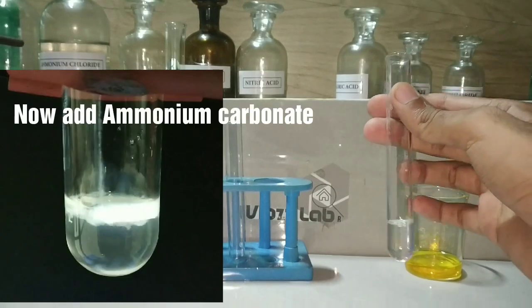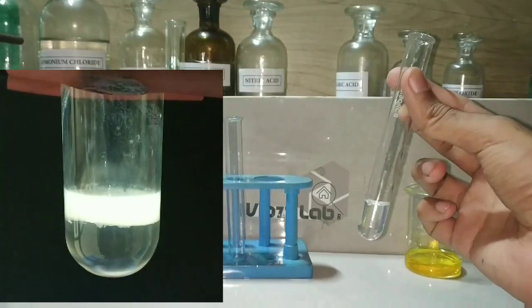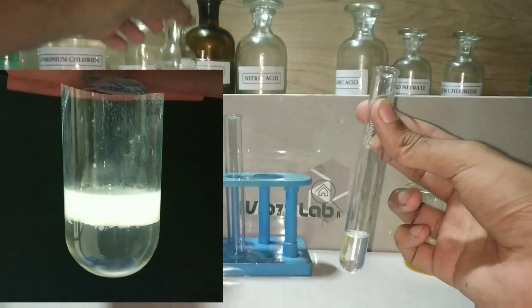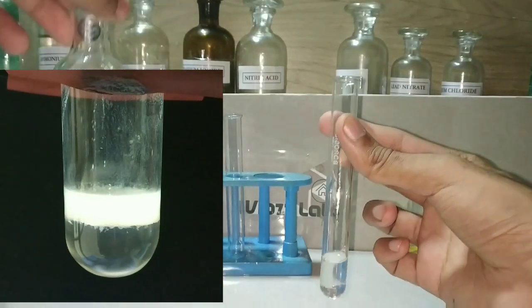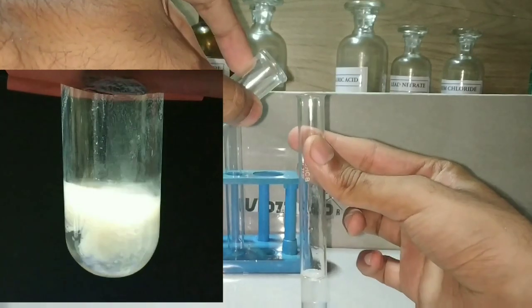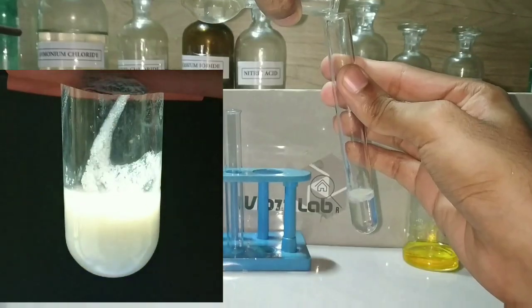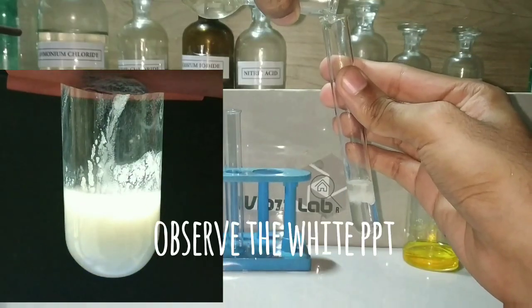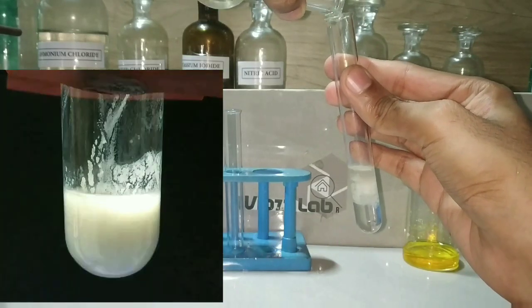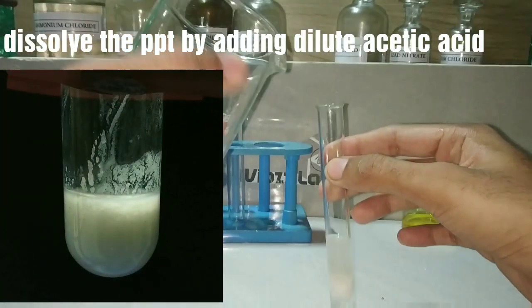The next step is to add the ammonium carbonate solution. Ammonium carbonate can be easily prepared in the lab by passing carbon dioxide gas through ammonia solution. On adding the ammonium carbonate, you can observe a white precipitate forming.